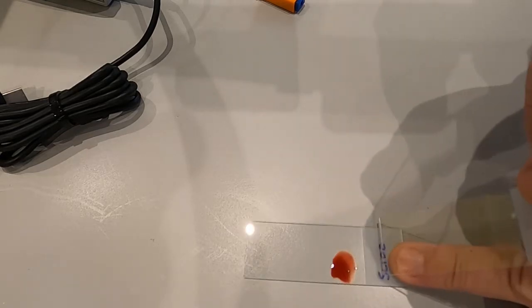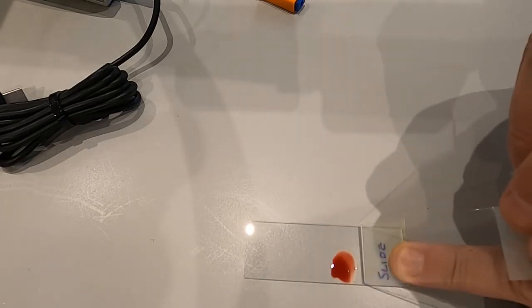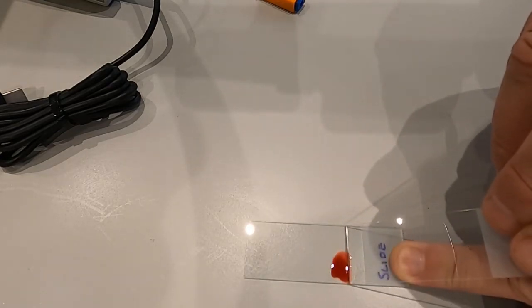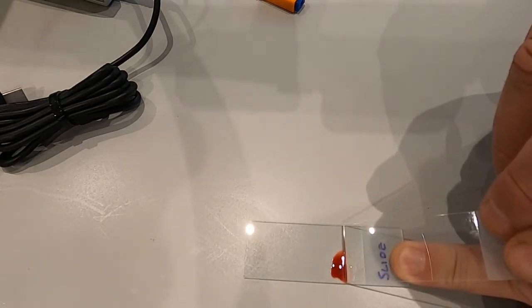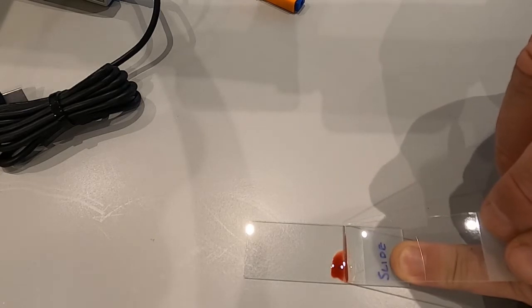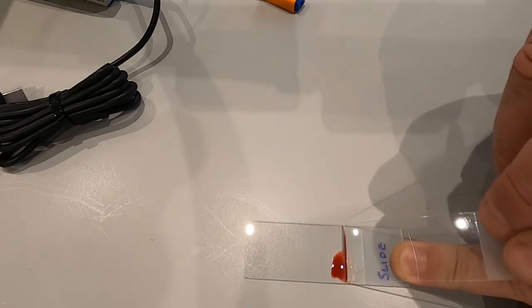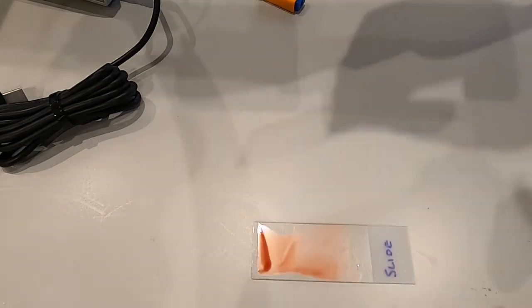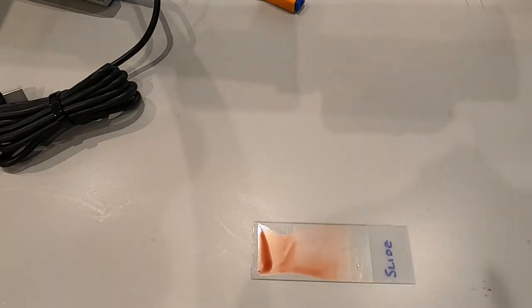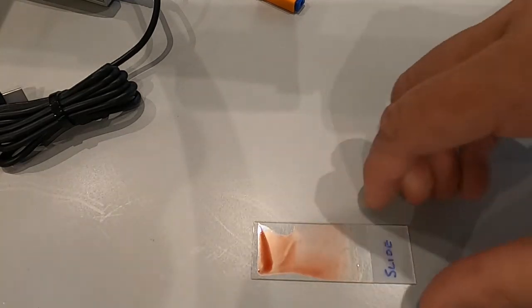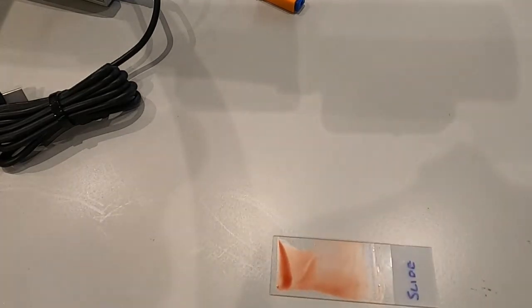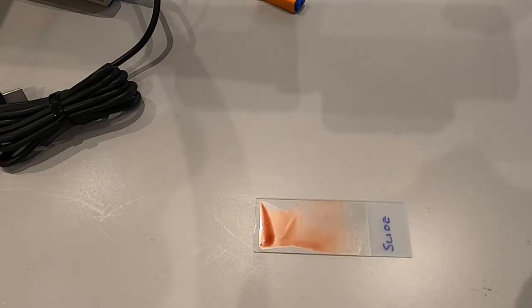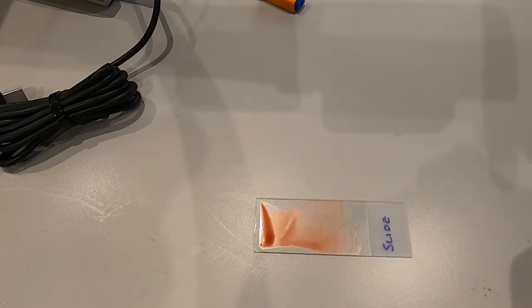Then place the first slide on top of the second. Touch the slide at 45 degrees, let it filter along the entire base, and then push. That's what you get - a nice thin blood film.